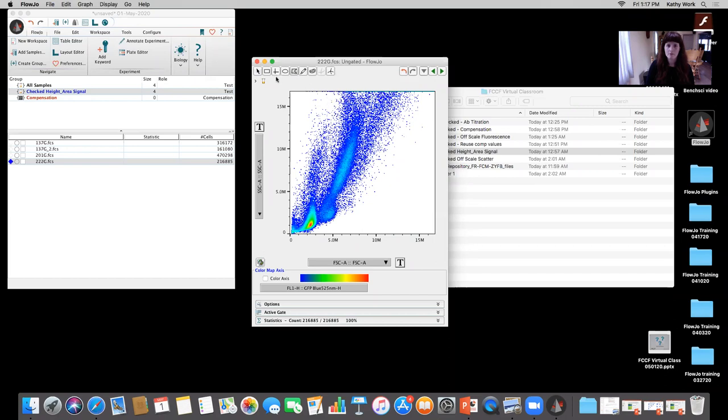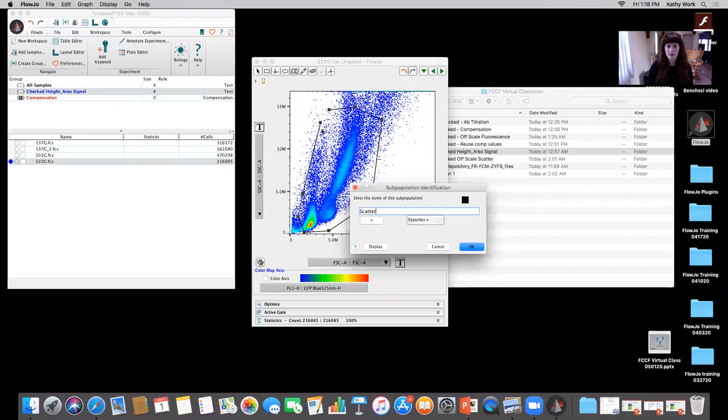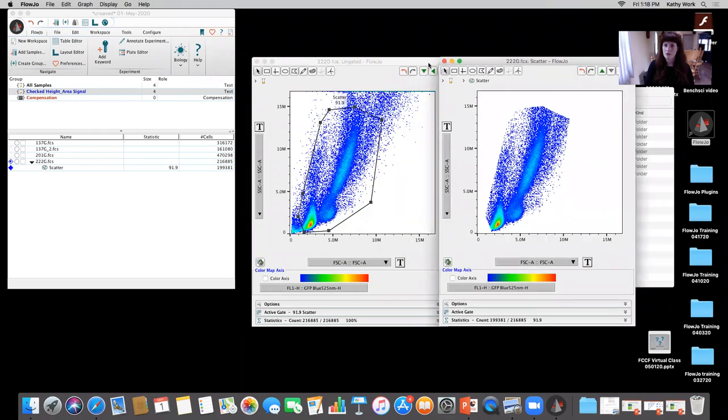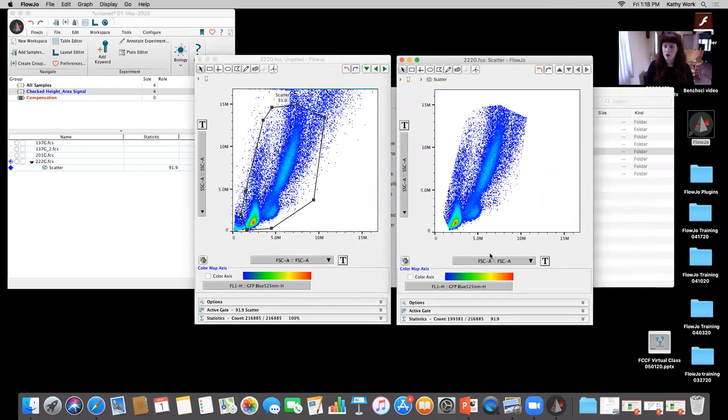If we go to the polygon, these are the different gating options right here. We have rectangular, quadrant, elliptical, polygon. You can go ahead and use this little pencil polygon gate right here, which I don't really use often. There's also auto gating based on the density and everything like that. There's multiple options, but I'm going to go ahead and use polygon. Because I haven't looked at a viability gate yet, I'm just going to assume all of these are alive, because we need a viability dye to really make sure. So we don't want to exclude anything just yet. Every click is a node, and I click on that last node. I'm going to just call that scatter because I'm not exactly sure what cells these are. If I double click, it opens up to our gated population, our daughter population, our child population.